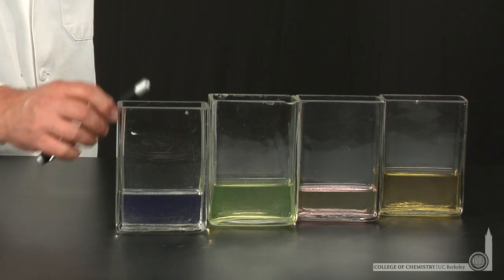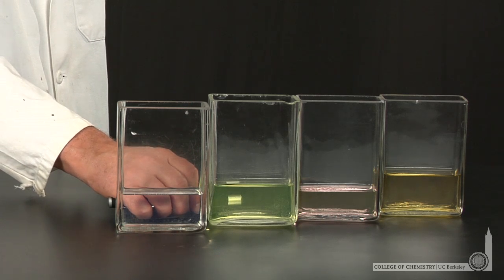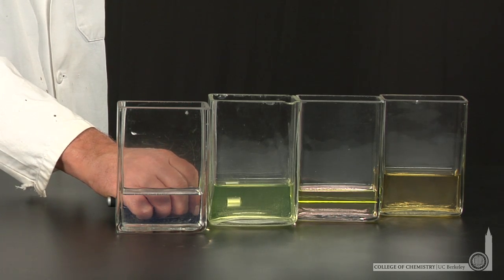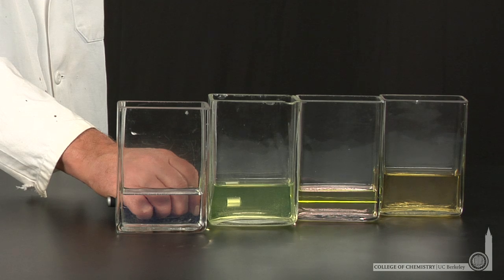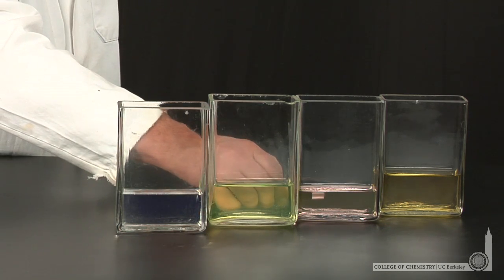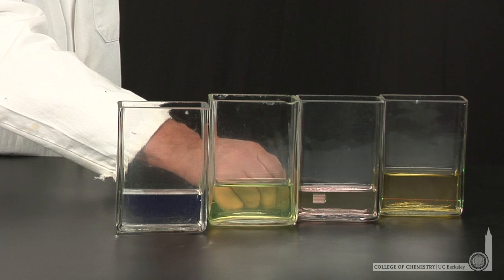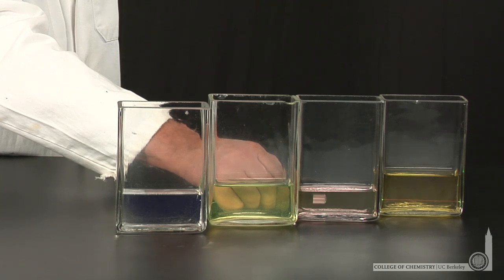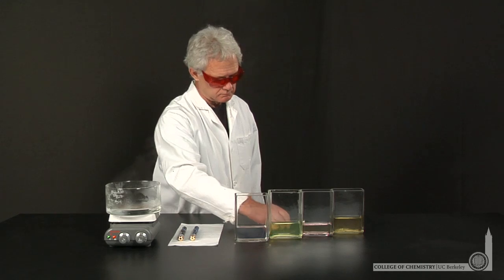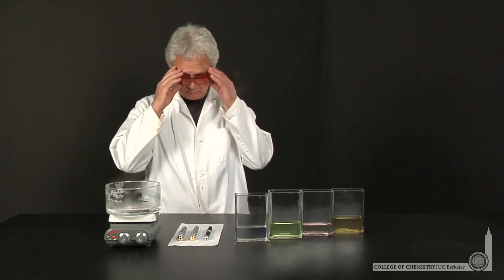The green laser stimulates emission of yellow photons from this solution, and the green laser stimulates emission of photons in the red region from the final solution. So laser-induced fluorescence has been demonstrated using lasers and colored solutions.